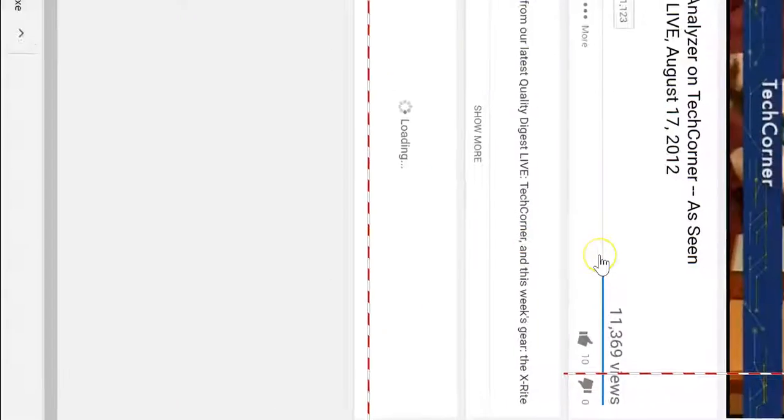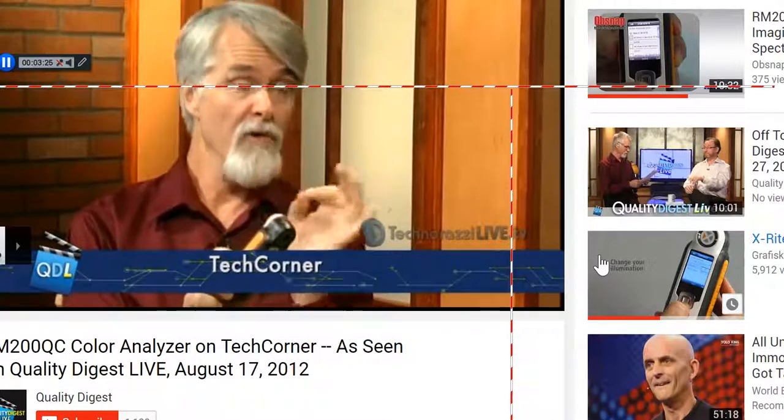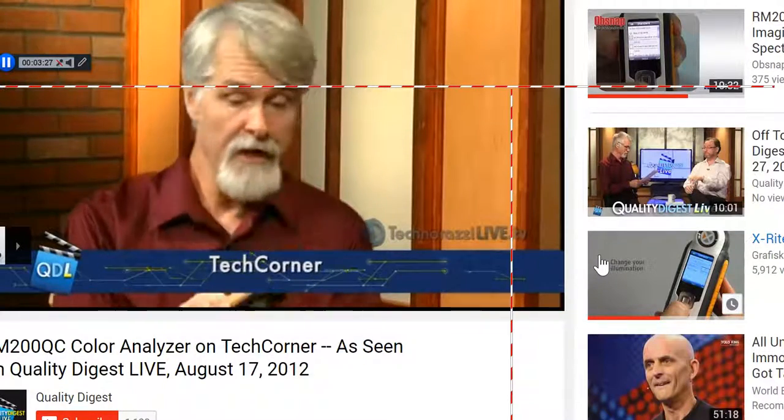Now I will say this is really used more for paint, fabric, plastic. It is not really intended for use on metallic. X-Rite has a different instrument for measuring, let's say, opalescent paints, metal flake paints. This really isn't an automobile paint measurement device. It's really intended more for flat, matte surfaces.